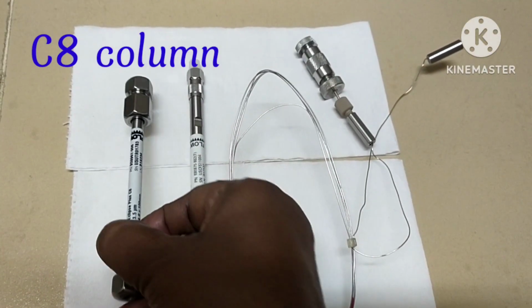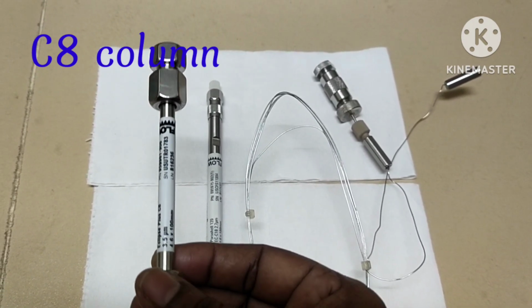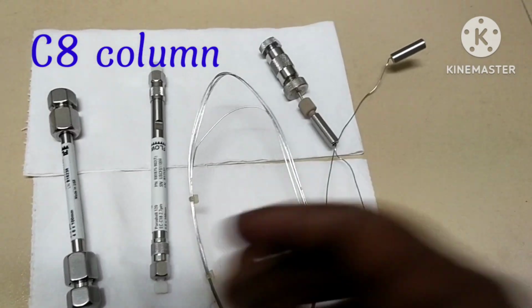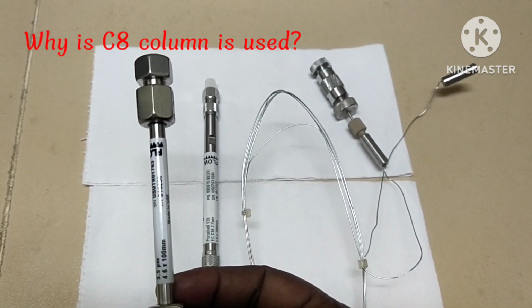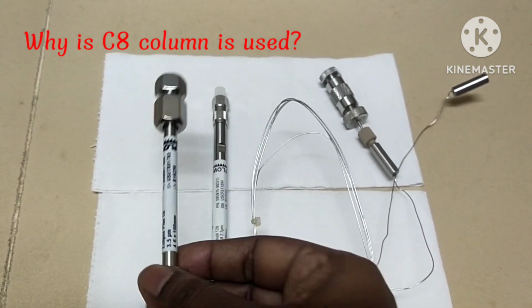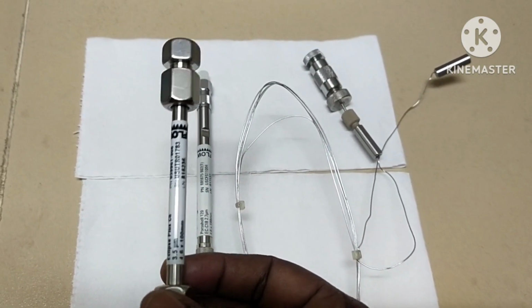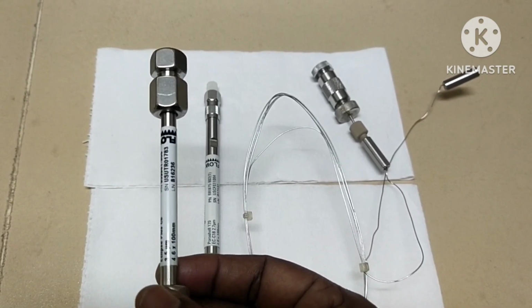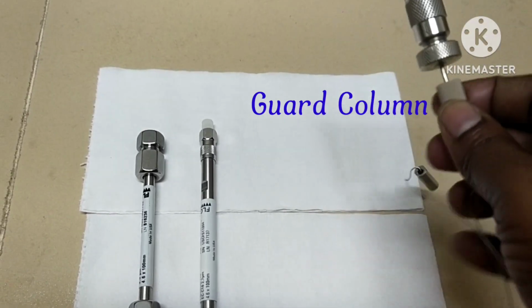It is a C8 column. It has octylsilane as its stationary phase and this compound in the stationary phase has 8 carbon atoms in its alkyl chain. Why are C8 columns used in HPLC? C8 HPLC columns are suitable for the analysis of a large number of non-polar substances and many ionizable and ionic compounds.